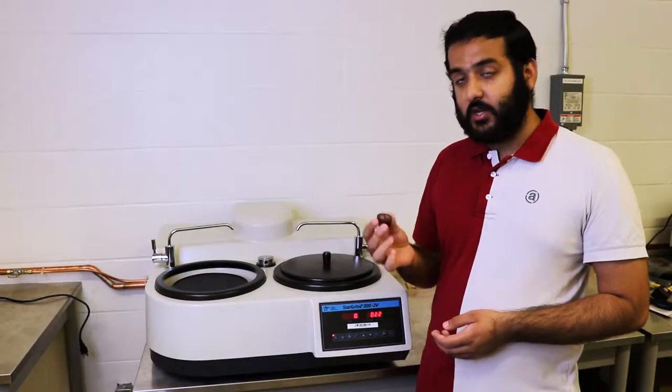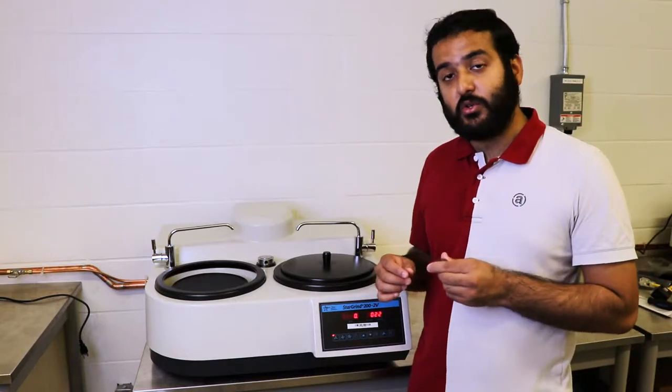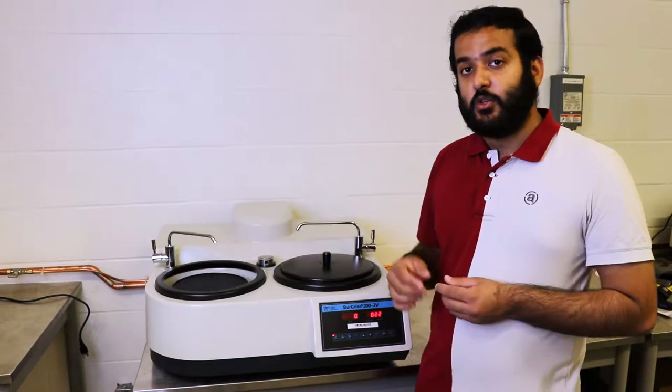With your sandpaper mounted, we're going to sand the sample you've got from the hot press machine. Before you sand your sample, you want to make sure that you use a little bit of water from the tap to run the machine.